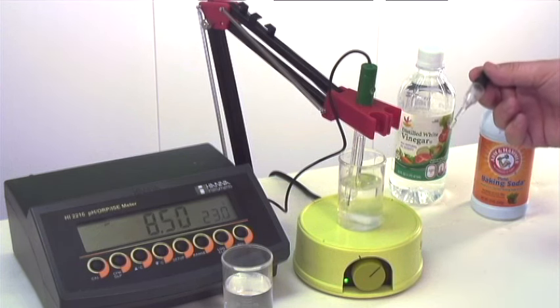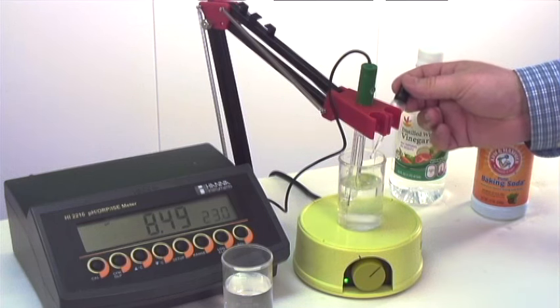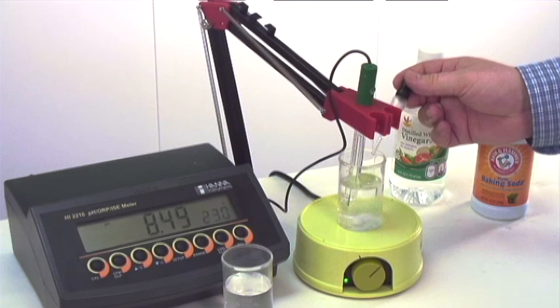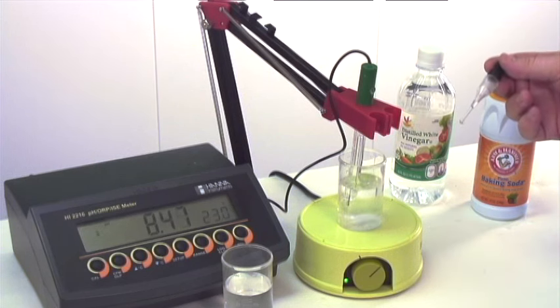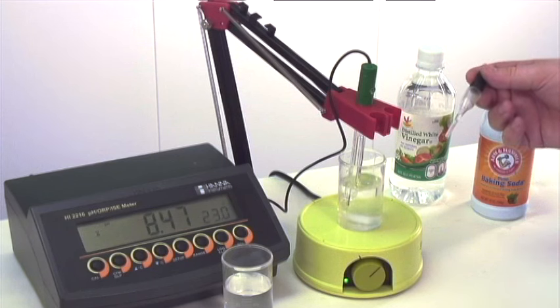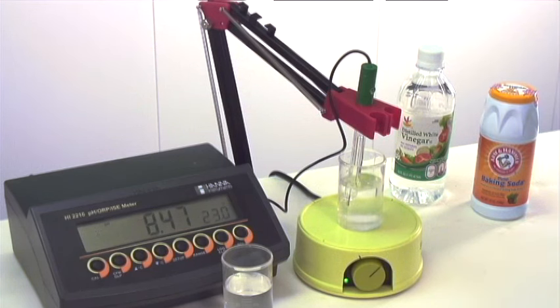One drop, and there appears to be no change in pH. A second drop—again, nothing. So I'm going to start adding the vinegar in at a quicker rate.